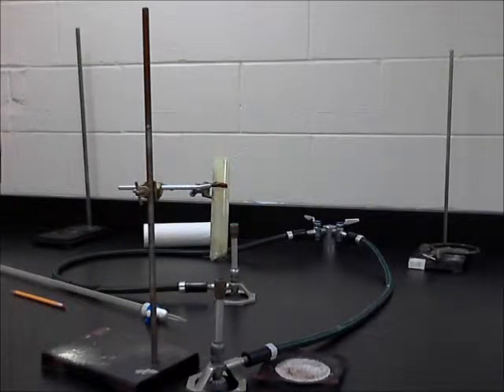Good morning and welcome to the Copper and Brimstone Lab. This lab is composed of basically two parts.